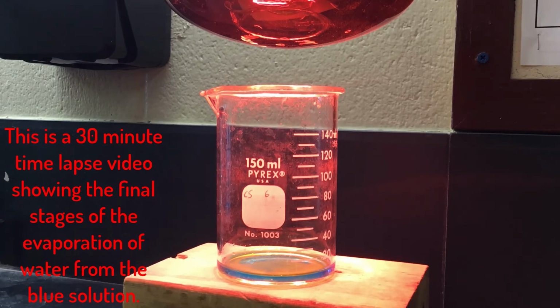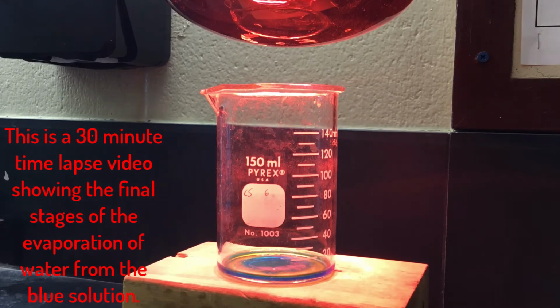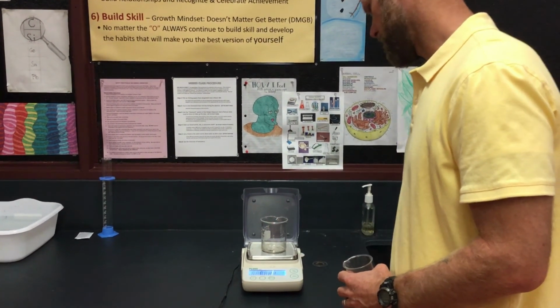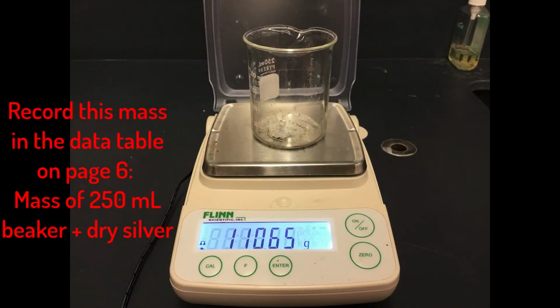You can see here that a pale blue solid remains after all of the water is evaporated from this solution. The next day, you should have a 250 milliliter beaker with dry silver in it and a 150 milliliter beaker with some blue-green solid in it. Place the 250 milliliter beaker on the balance that reads to the hundredths place. Record this mass in the data table on the top of page 6.